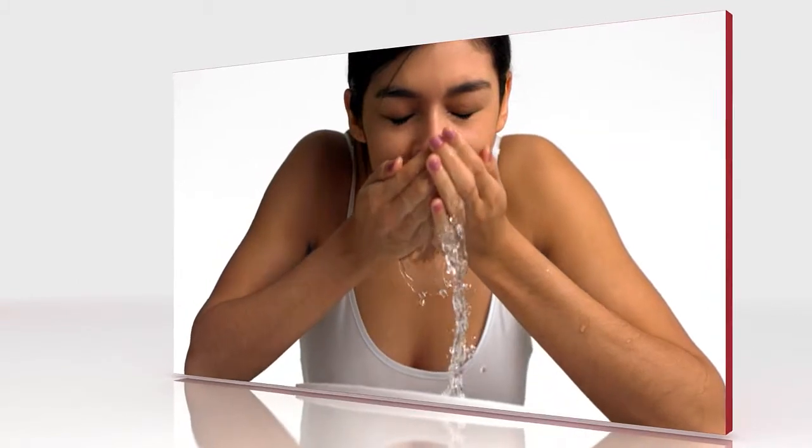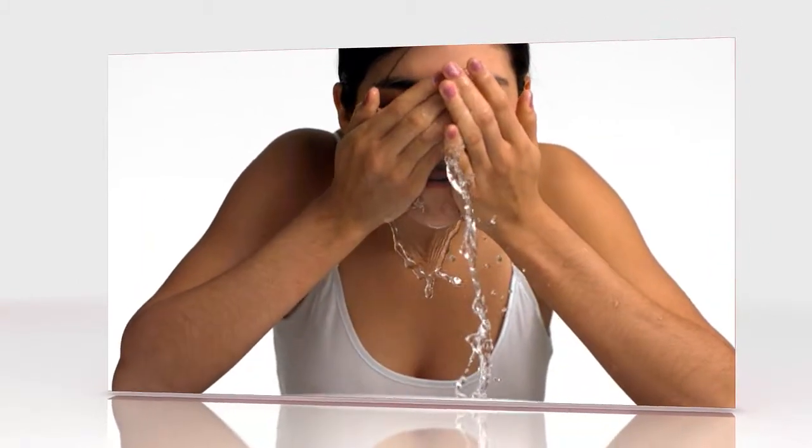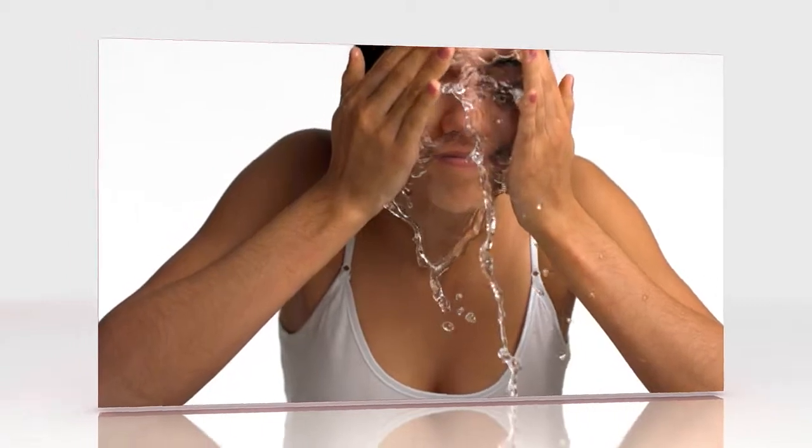Human skin. Porous yet waterproof. Sturdy yet flexible. It's a wonderful and complex barrier to diffusion.